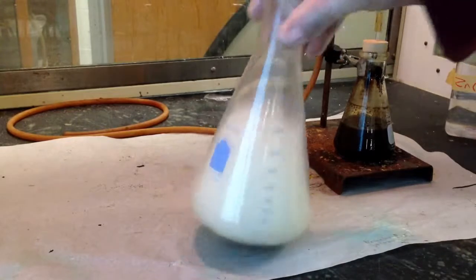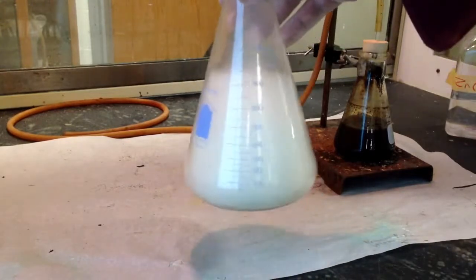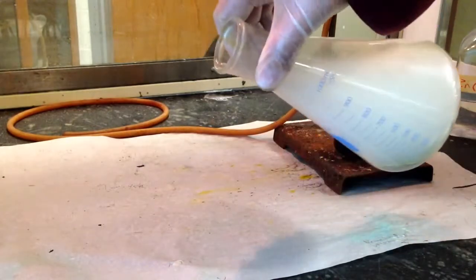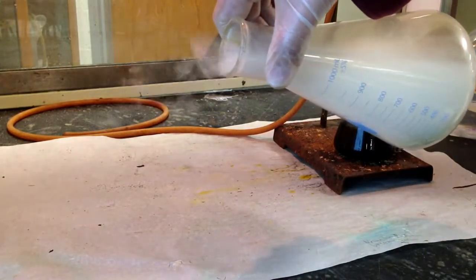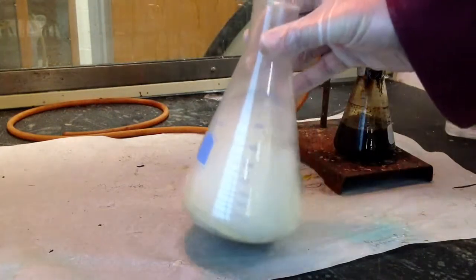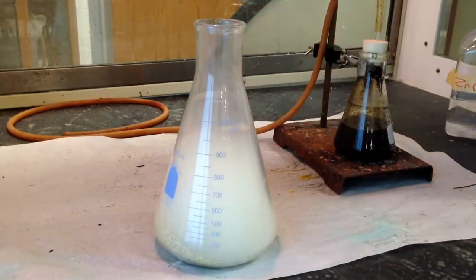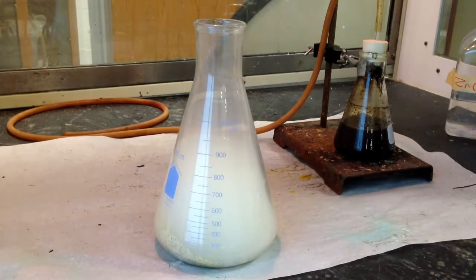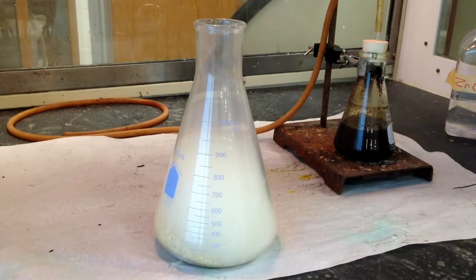So as this calms down, we notice this is pretty thick smoke because this is essentially sodium chloride. So I can actually pour this out because it's really solid. But what I want to do is I want to wait to see what it looks like after it's done. When it's done, when all that sodium chloride dust settles, we should be able to see a crystal lattice in the spot where the sodium was.